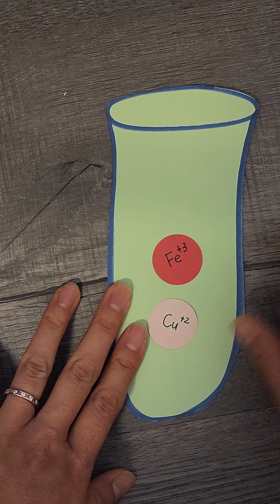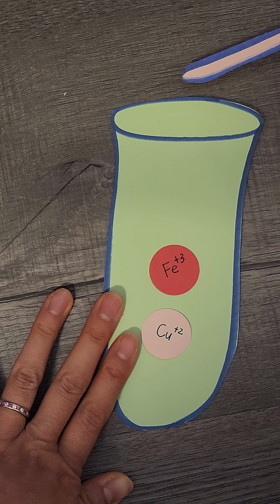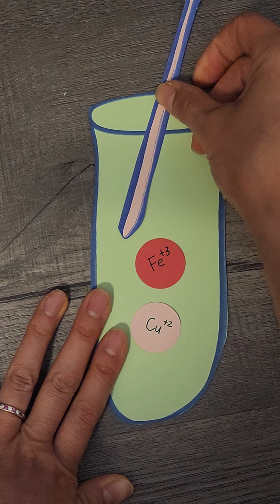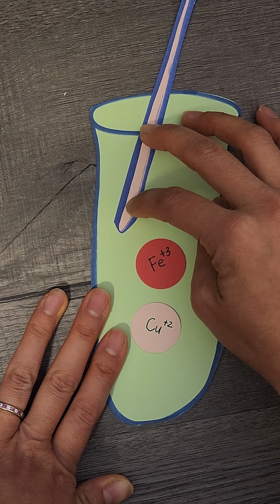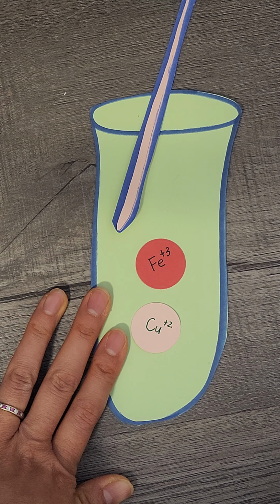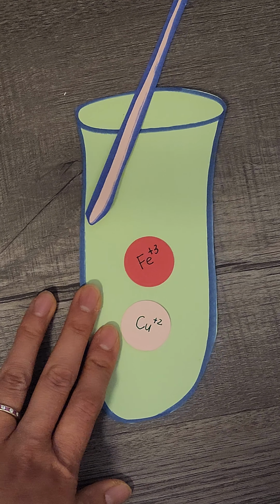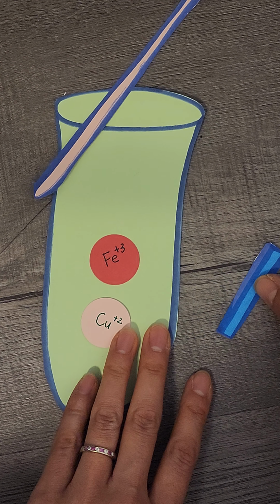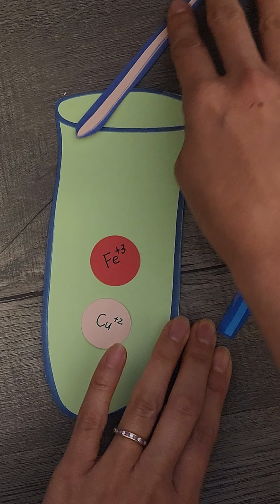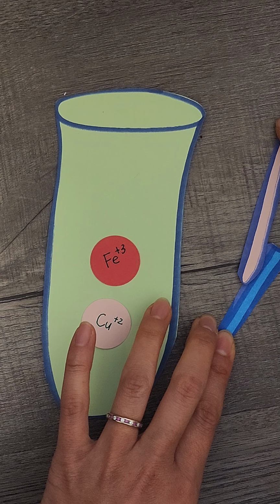What you're going to do is take a stirring rod and slightly dip it, just so that the liquid touches the tip. Then you're going to bring in a litmus paper. It'll be purplish in color. It's not exactly purplish, but let's just pretend it is. Then you dip that liquid onto the litmus paper.